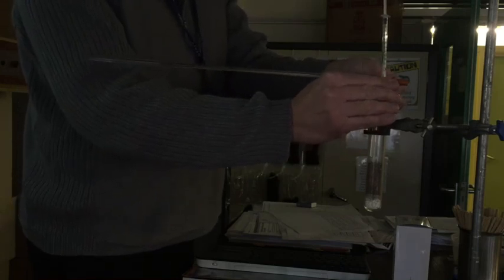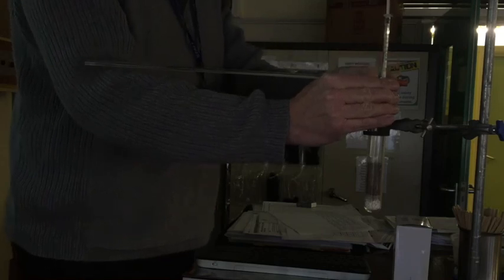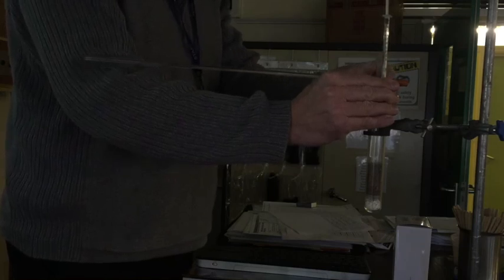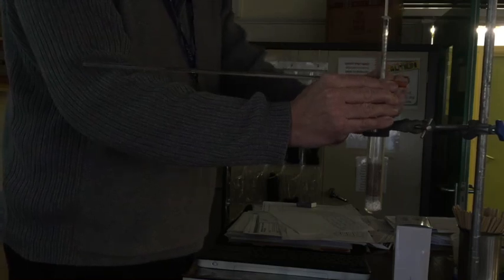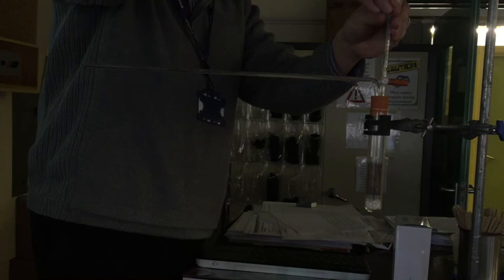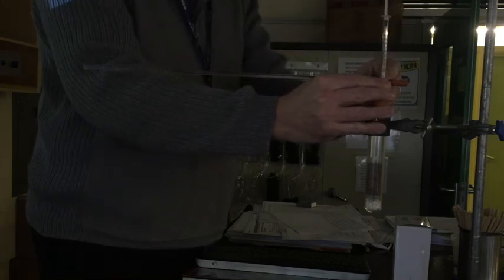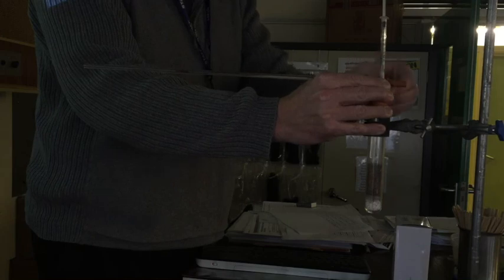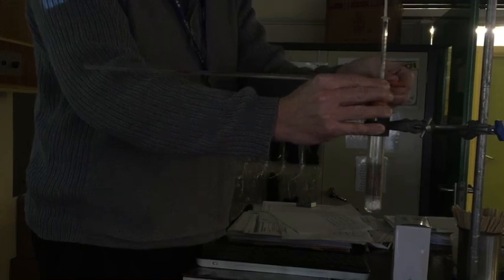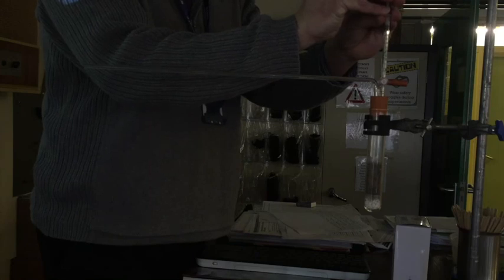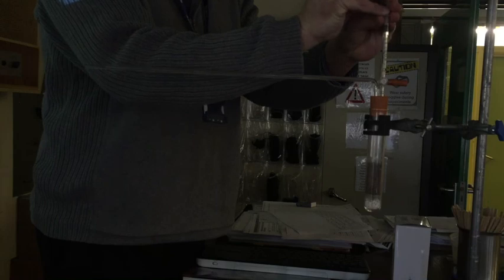So I'm going to stop the experiment. I'm going to close the valve off. I'll just show you the syringe bit. To do the syringe, what I'm going to do is I'm just going to close it, put it like that. And I can just push slightly down on the syringe, very slightly. If I push too hard on the syringe, it will just shoot out the end. I can move it all the way back to the end, like that.